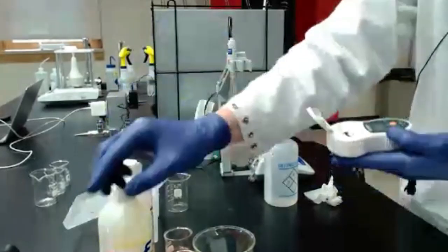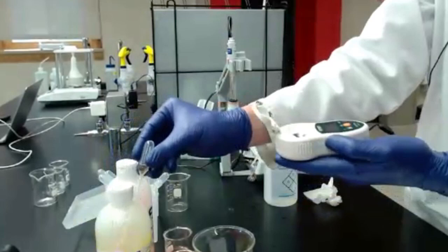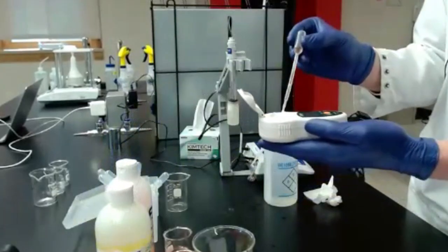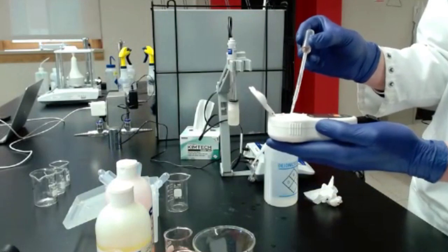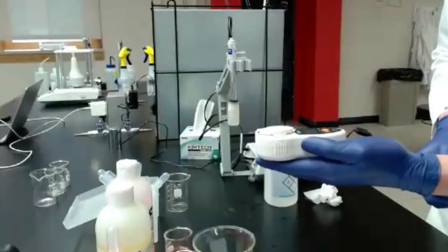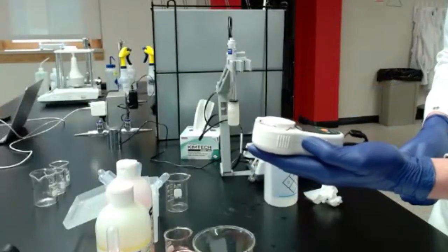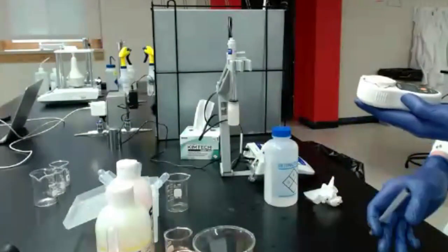So next, I'm going to show the digital, with the measuring with the juice. So you can take that transfer pipette, again, popping any bubbles that are on there, and then close that and wait for it to give me a value. Good.